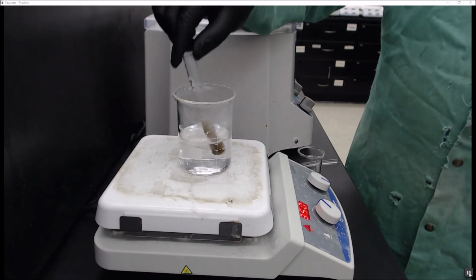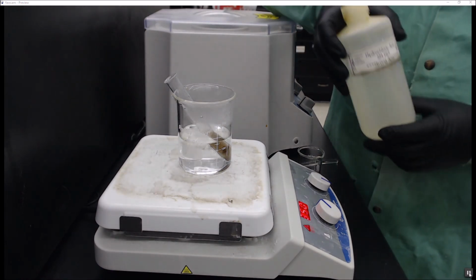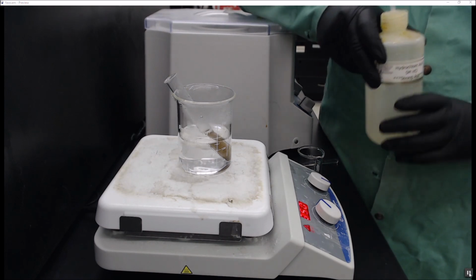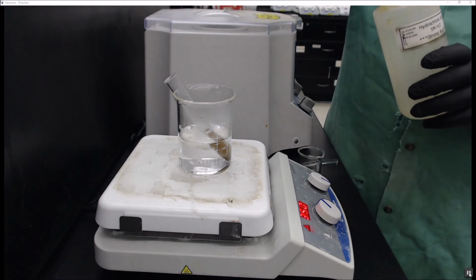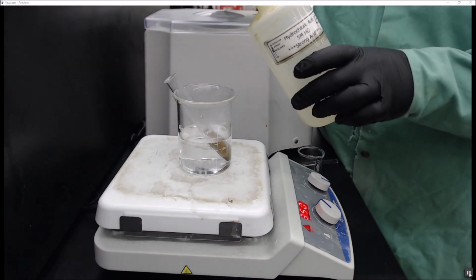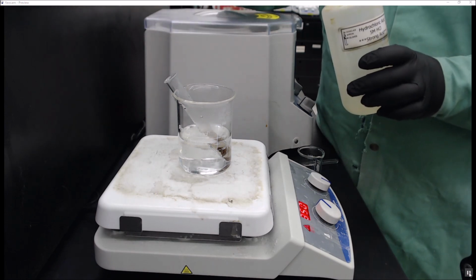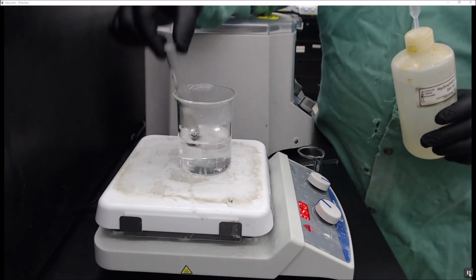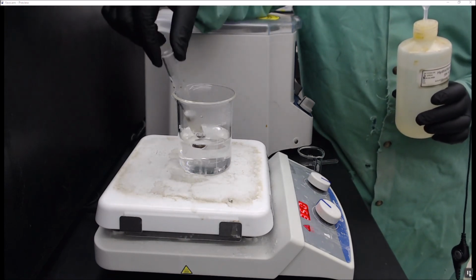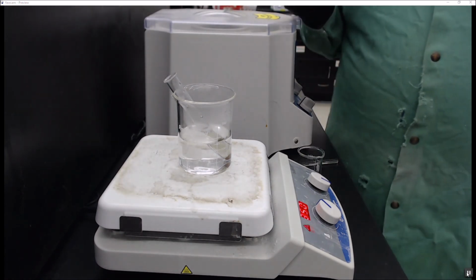So to do that, we are going to carefully add a couple drops of 5 molar HCl. I'm wearing goggles, gloves, and a lab coat. So are you if you're handling this. I know the lab's probably 1,000,000 degrees. This stuff is hotter. Be very, very careful. Just a few drops. And you see how that immediately begins foaming and turning clear as we react to magnesium. Let this sit for a couple more minutes before you add the rest of that pipette.